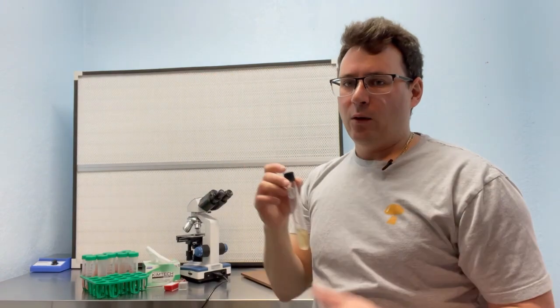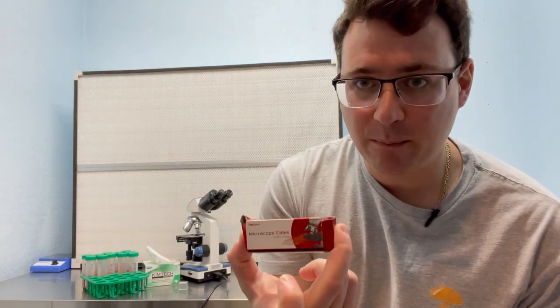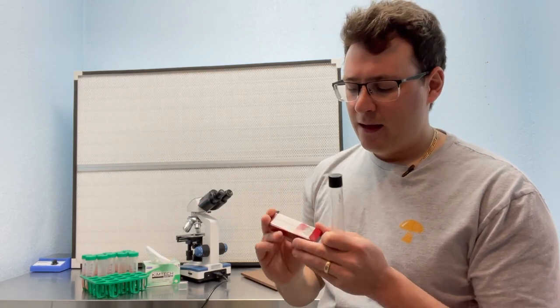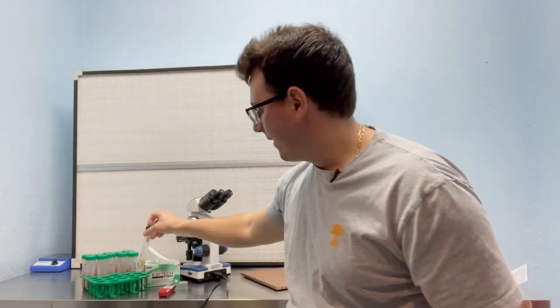In order to check that this is clean mycelium, I'm gonna use my microscope here, and we'll be using a wet slide prep. If you didn't see the video on different slide preps, go check out our microscopy series. But I'm just gonna be using one of these concave slides to put a few drops of this liquid culture, and then we're gonna check it under the microscope to see if it's pure mycelium or if there's any potential bacterial contaminants or yeast.